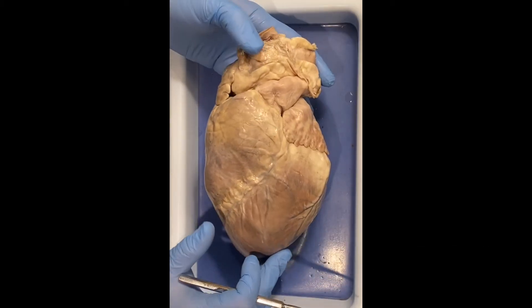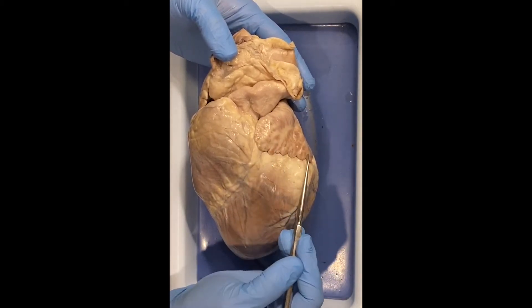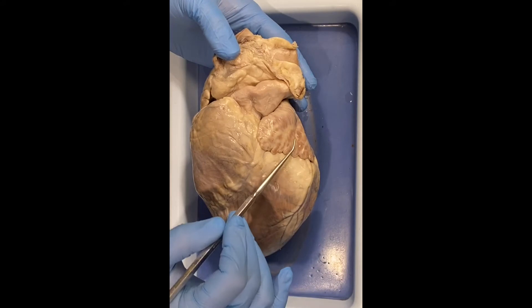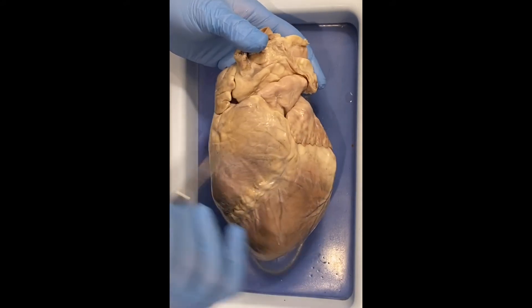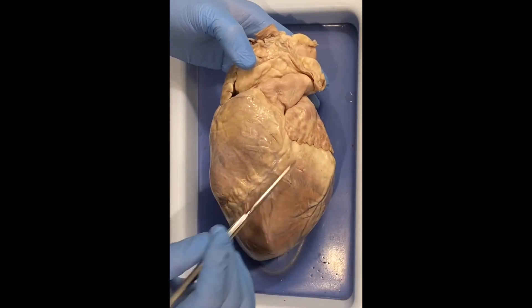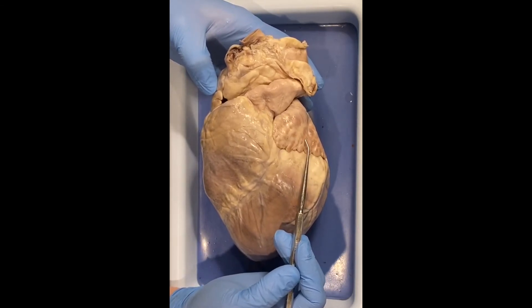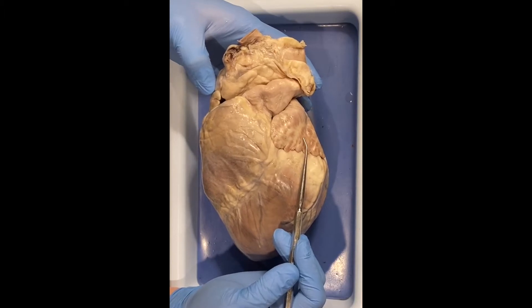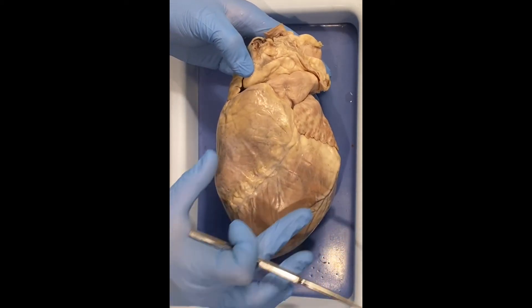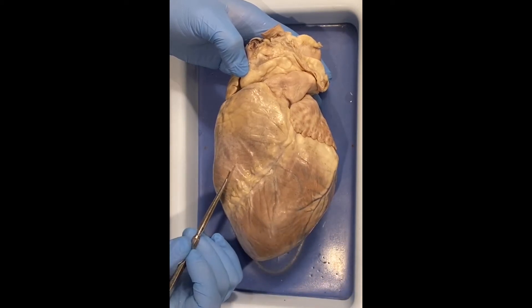There are two chambers referred to as the atria, and they look a little bit like ear flaps on the top. Sometimes they're referred to as auricles, which also means ear. This is where the blood is returning back to the heart — there is one on the right side and one on the left side. Think of the atria like the atrium of a hotel: the first entry point into the building, and the first entry point into the heart.